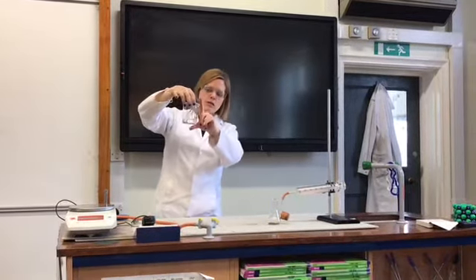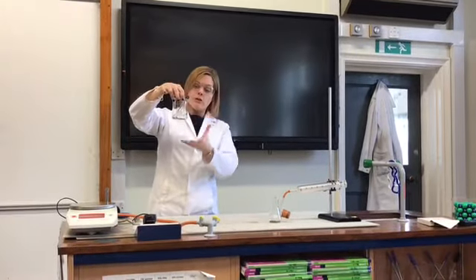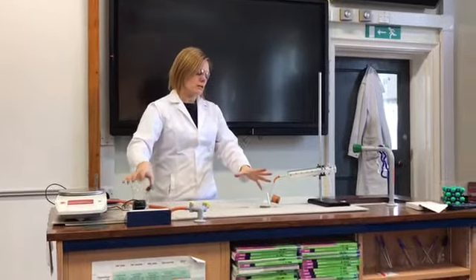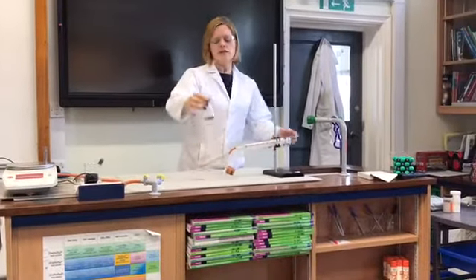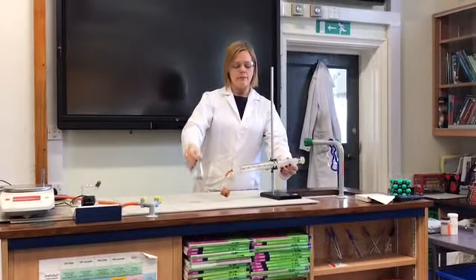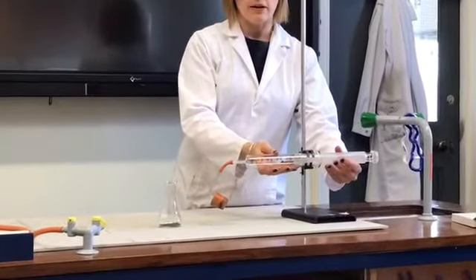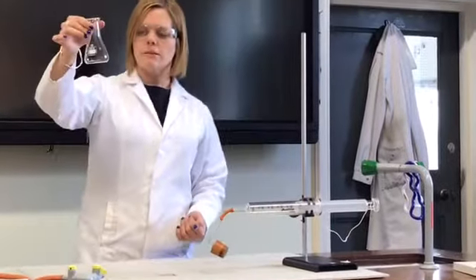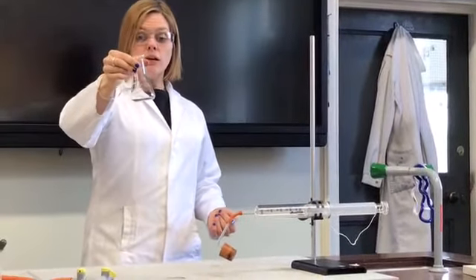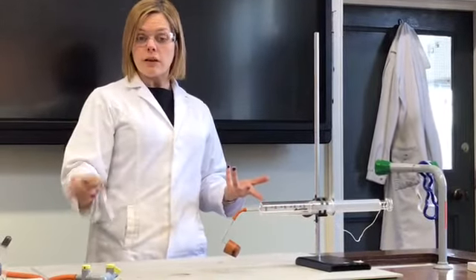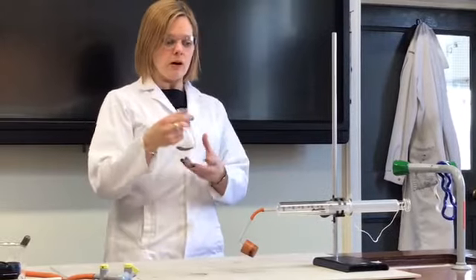A second method we could use though to perhaps improve on this one, but using exactly the same reaction, is this kit here. So inside this flask I've got some iron again, but this time I've decided to use iron filings. So that's iron that's just finely divided into small pieces. Again at the minute it's dry and again I'd like to use this rusting reaction as a way of removing the oxygen from the volume.